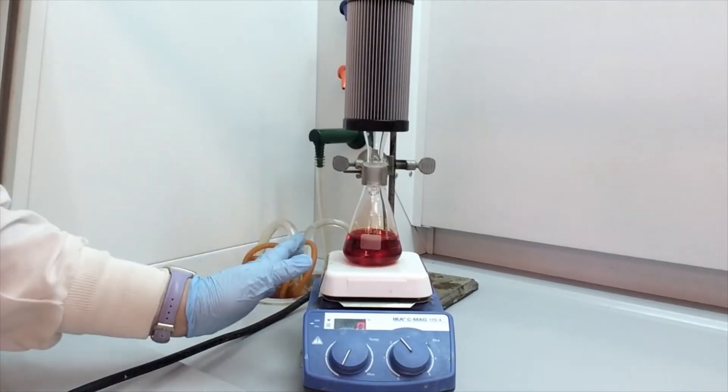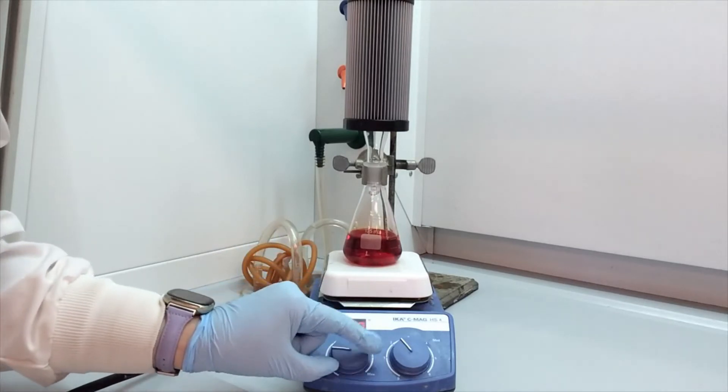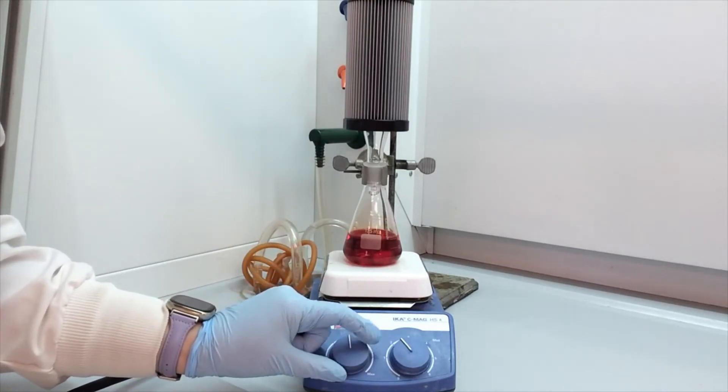So now we do with this flask, we need to heat the plate. So I'm going to set this to about 250.